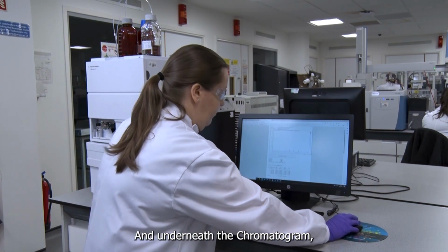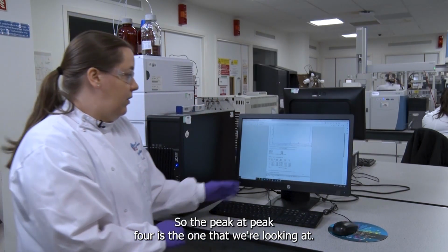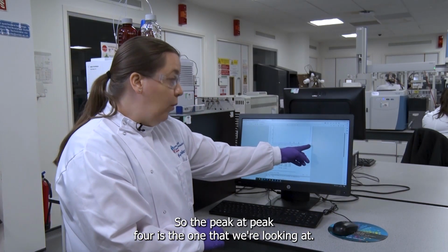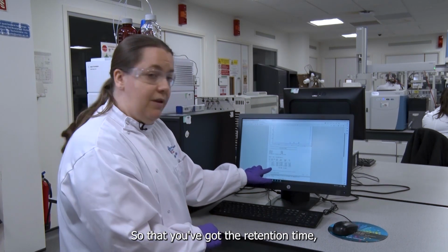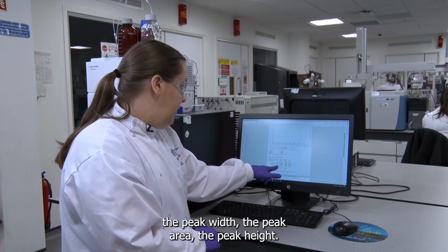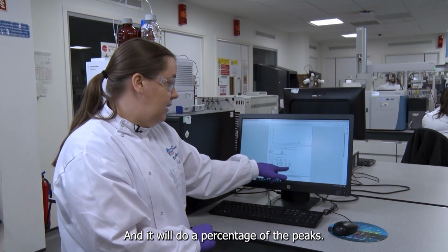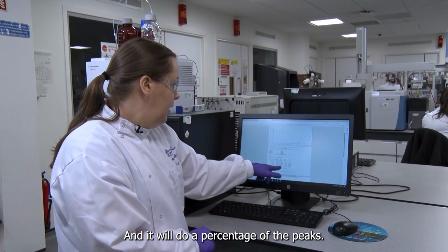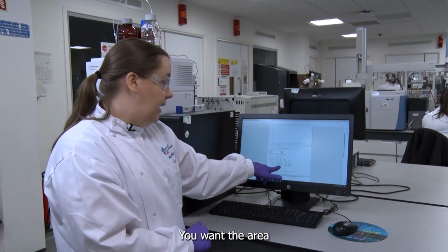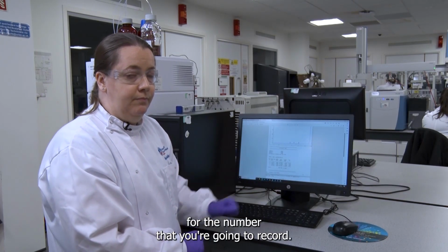And underneath the chromatogram, you've got the table for the data. So the peak, peak 4, is the one that we're looking at, so that you've got the retention time, the peak width, the peak area, the peak height, and it'll do a percentage of the peaks. You want the area for the number that you're going to record.